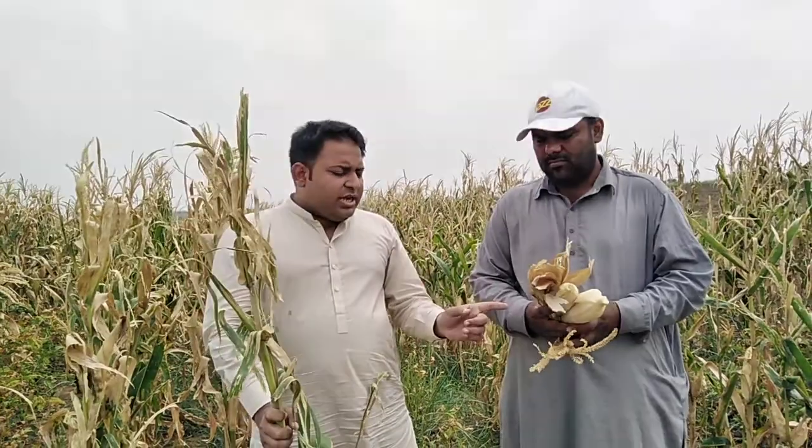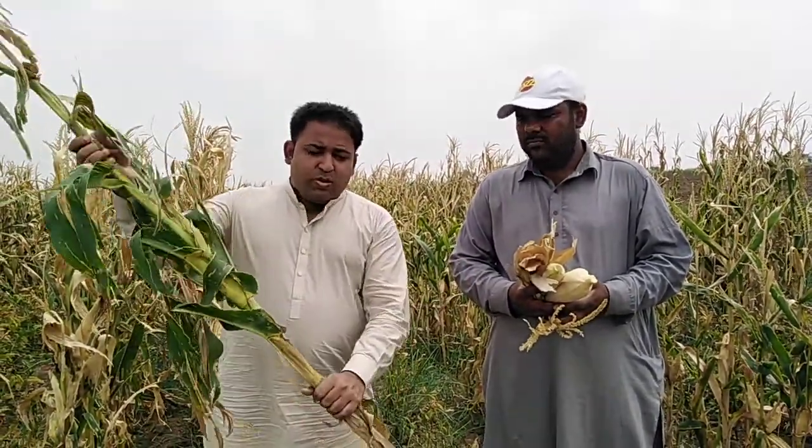Then after 4 days you will measure the weight. Then after 2 hours you will measure the weight again. If the weight is constant, then you don't need to dry it again the next day. If the weight is not constant, then you need to dry it for another day. So the next day you will take the weight, and then after 2 hours you will measure the weight again. If the weight is constant, then it means your sampling is final. Now, what will it tell you? It will tell you how much dry matter the plant is investing in roots, stems, leaves, cobs, and then the tassel.